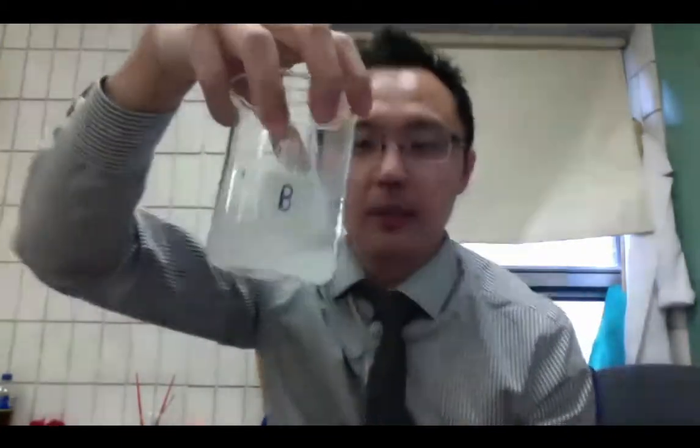So now I'm going to do the same thing with red and blue litmus paper and I'm going to see which one will change. So here's my red litmus paper and here's my blue. So here's red and here's blue.